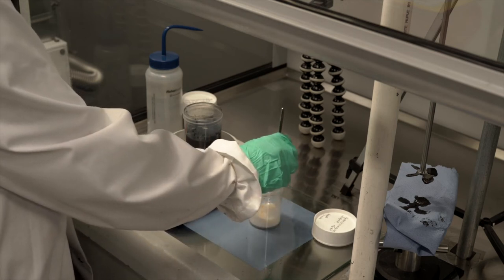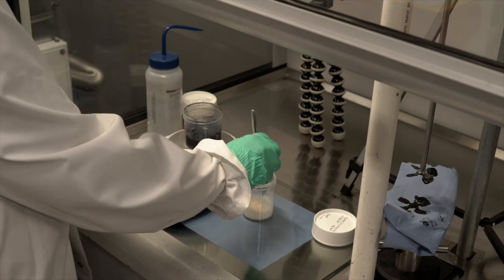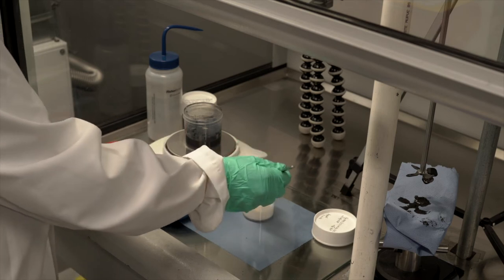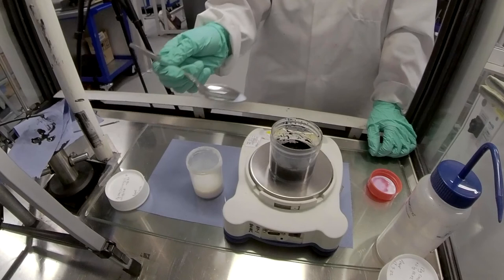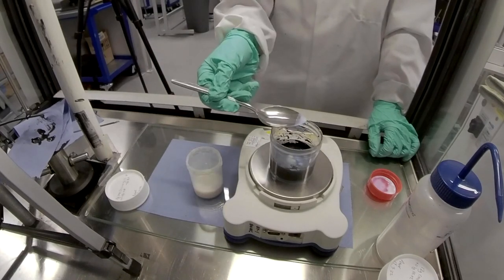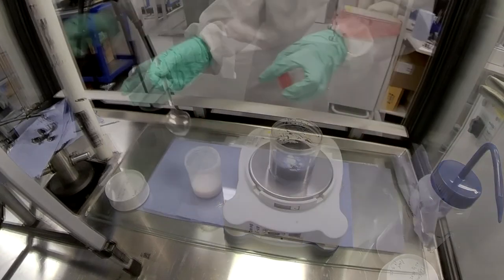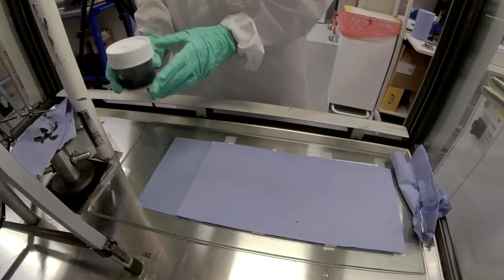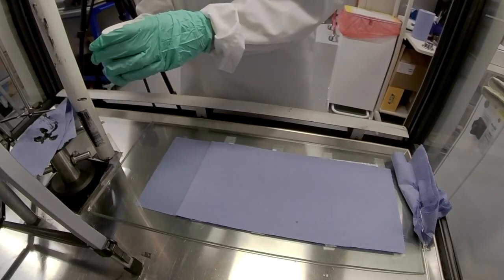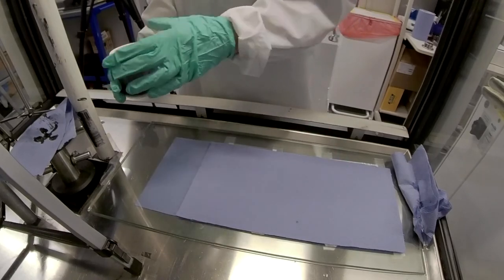Once this is dried, it is not water soluble. So you want to make sure that your tools are really clean before you put them away. So I've gone slightly over. It's 0.49. Now I'm ready to mix my SBR into the slurry. Right after that, I'll spread it before it has a chance to separate out.